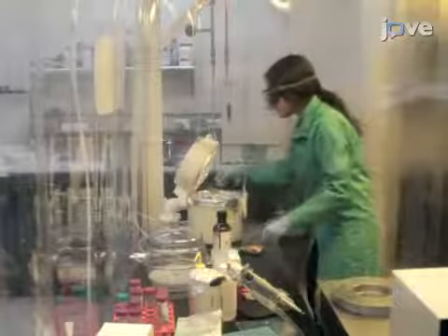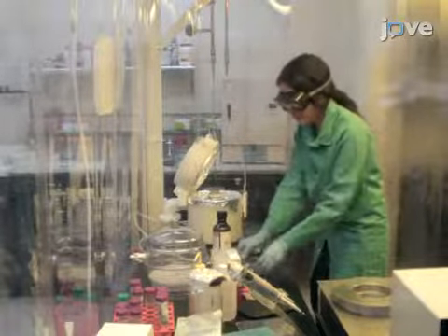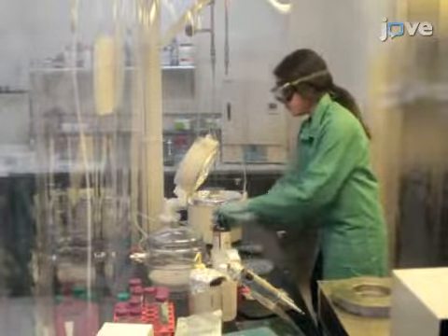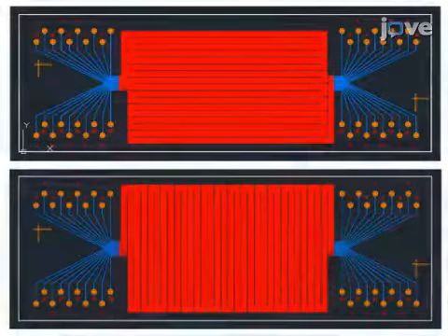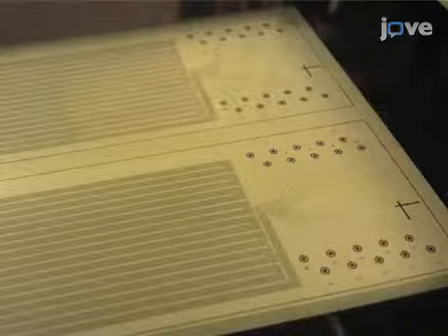In advance, generate the SU8 master for the barcode flow patterns. Instructions are provided in the text protocol. This involves designing and making a chrome photomask. Placing the mask on a photoresist coat and applying UV provides the pattern.